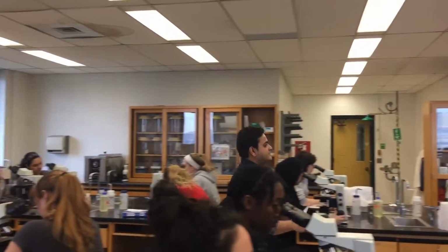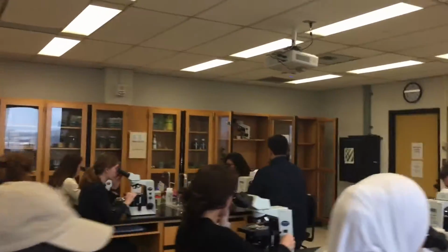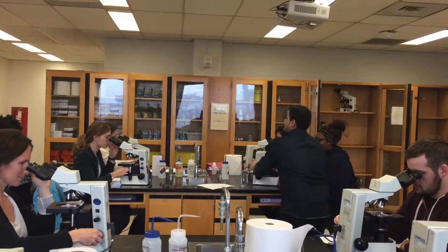Raise your hand if you need something. I'll be right there. Have a look real quick. Yeah, that's good. Good job. So move to 10x now.